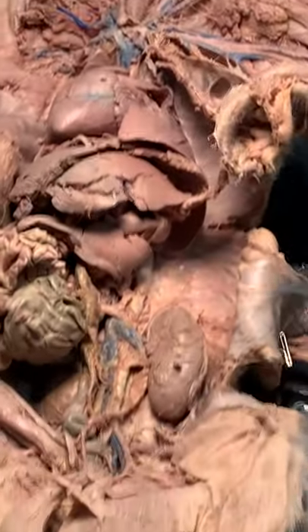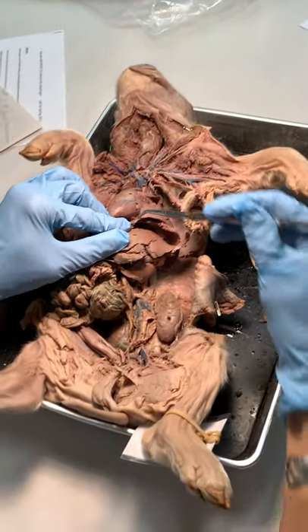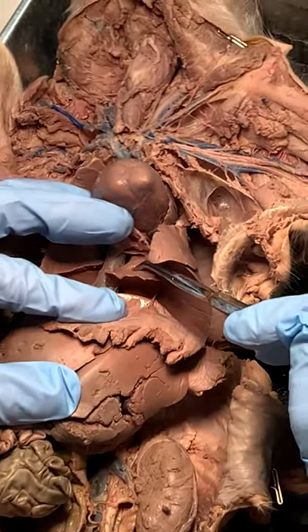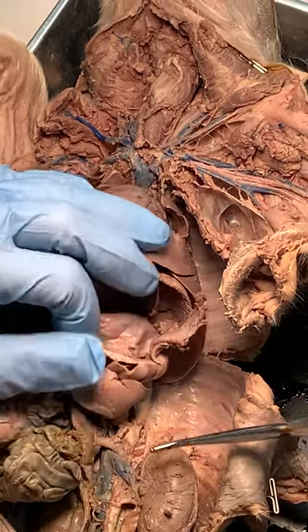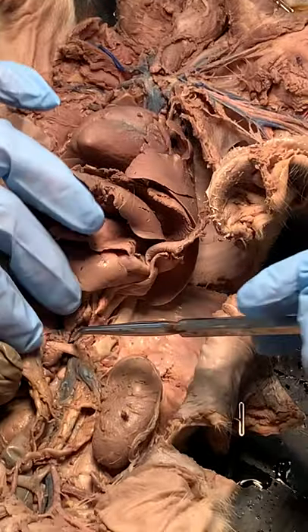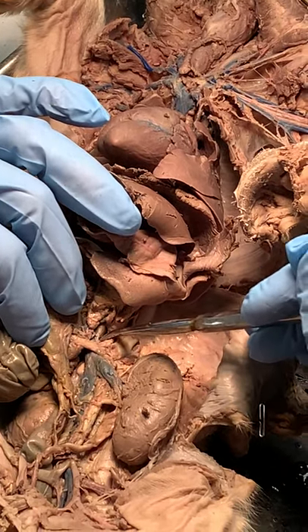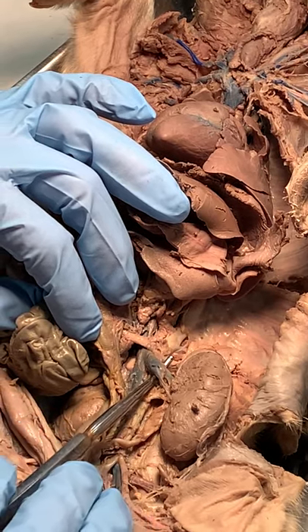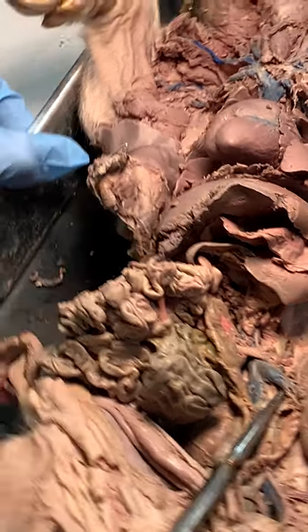Let's do the veins. All of these are going to come off of the posterior vena cava. The first thing we'll do is find the posterior vena cava — we can see it coming down here, towards the right. There it is, coming down. I can see the renal vein right there, no problem. There's the left renal vein.